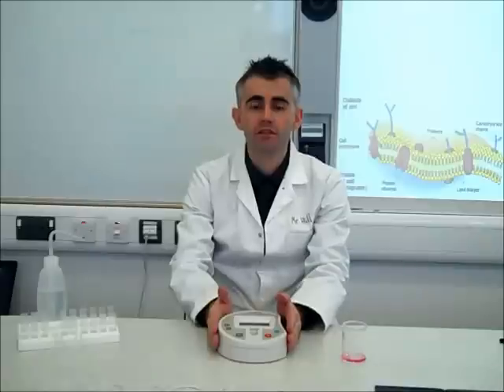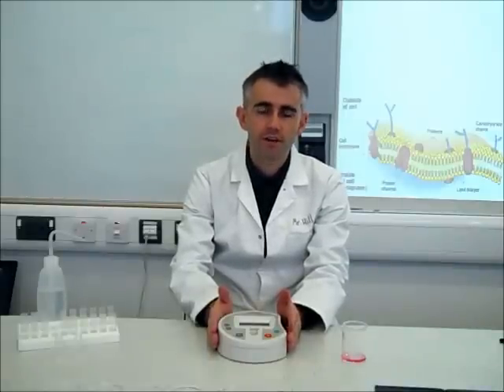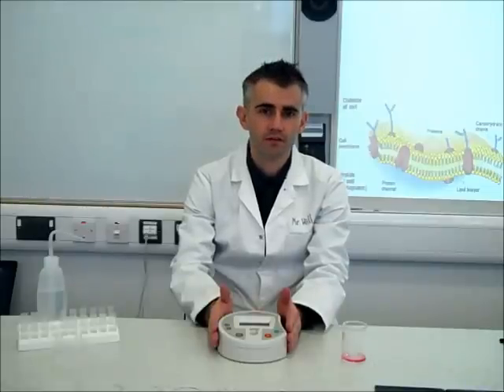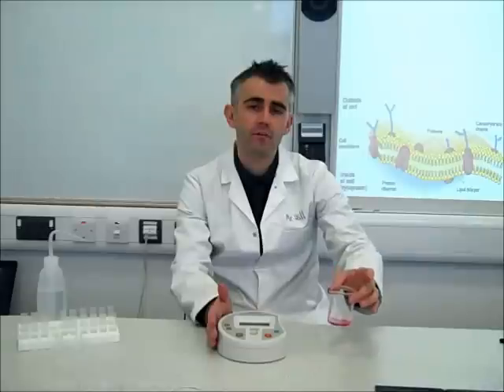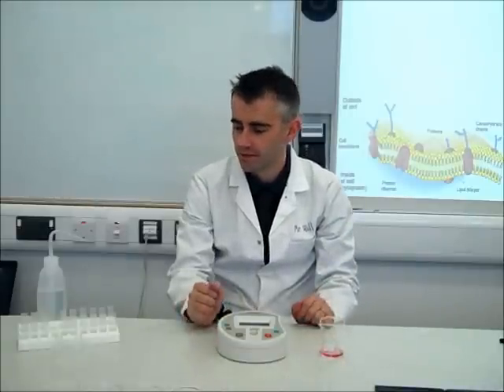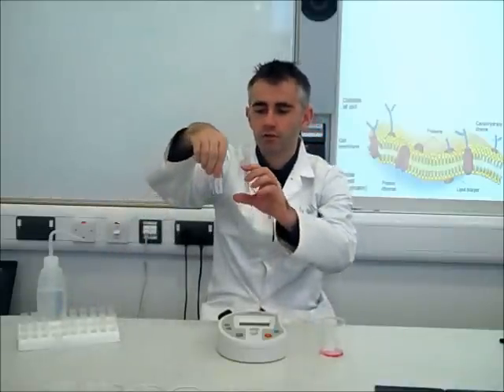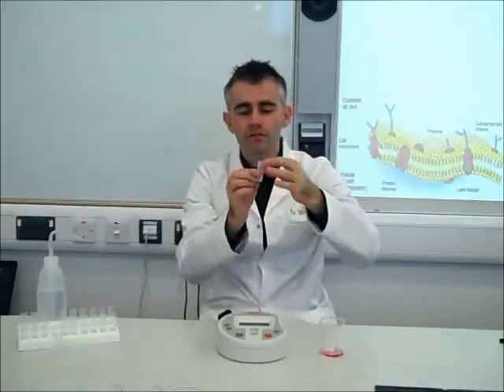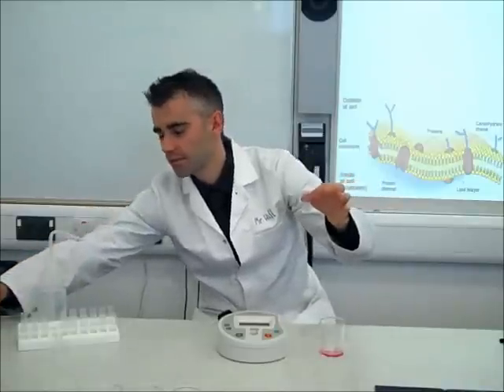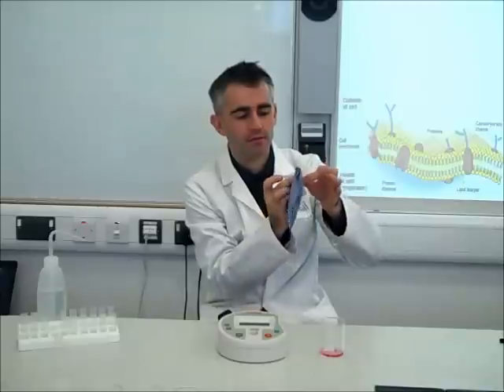Inside the machine there is a filter. Different coloured filters are used for different coloured solutions, and it's very important that the same filter is used throughout — it filters out certain wavelengths, only allowing specific ones to pass into the solution. Different coloured solutions will absorb or transmit more or less of different wavelengths of light, so keeping the filter constant is essential. The containers we put the sample in are called cuvettes. Make sure they are very clean, and it's worth swilling them out with the same type of solution you'll be testing, then wiping both clear sides with a paper cloth.